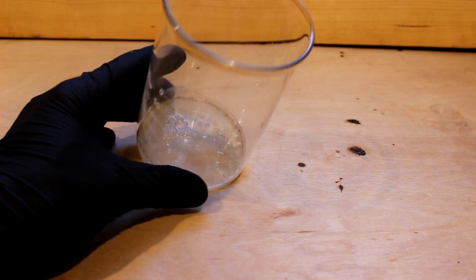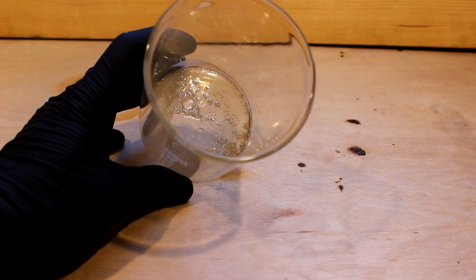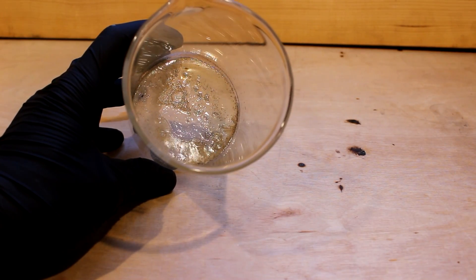After evaporating down, this is what I'm left with. A material that looks a lot like melted sugar, which is slowly crystallizing from the sides, if you can see there.